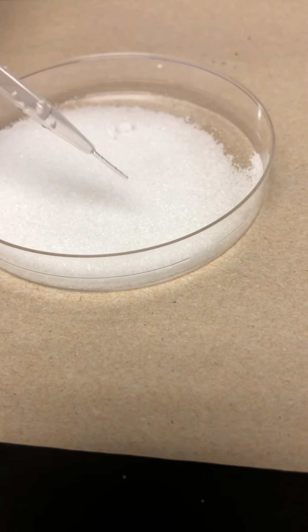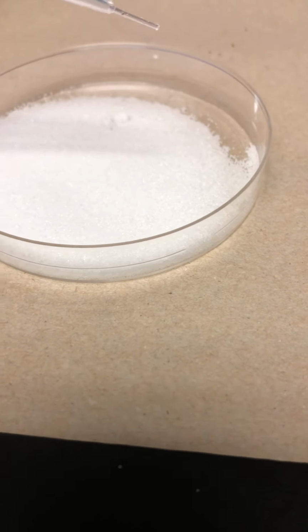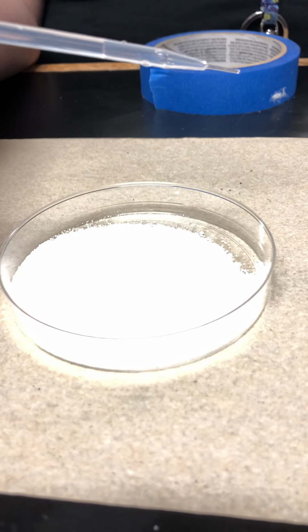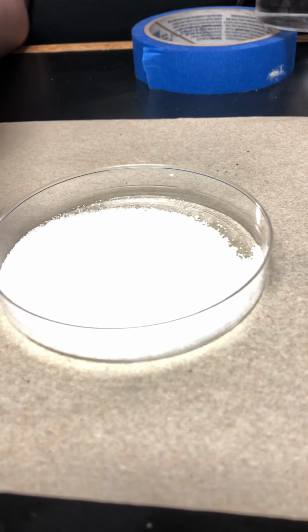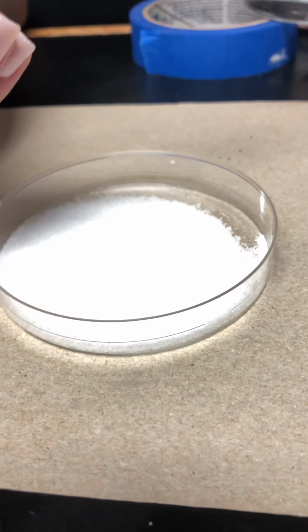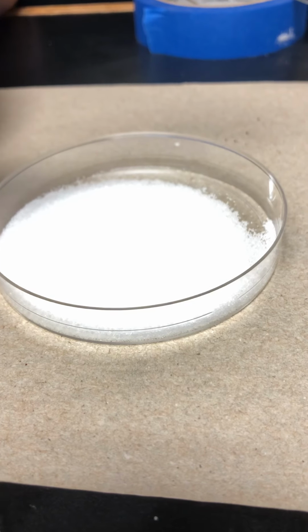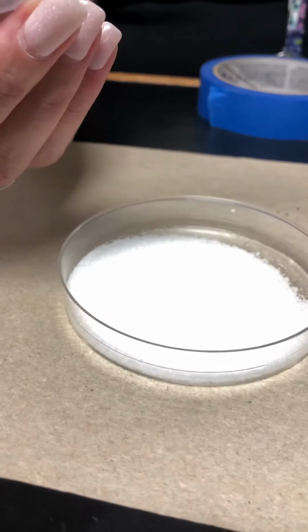Yeah, it's lots of beakers for not as much stuff, but they're just doing physical and chemical properties. And then later, we use most of these same substances when they do chemical changes. Oh, yeah. I'm just trying to record it. Oh no, you're fine. I'm going to edit it anyway because I'm going to put in questions on Canvas, that way my at-home kids can see it.